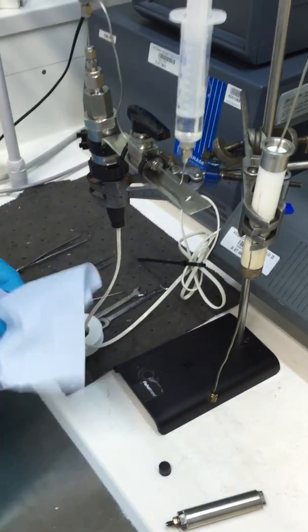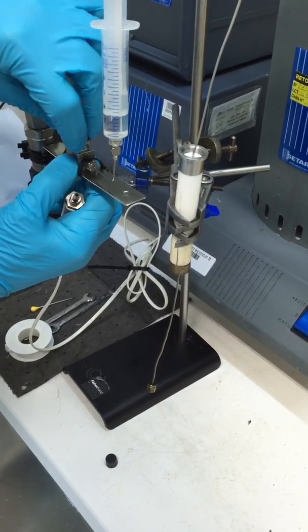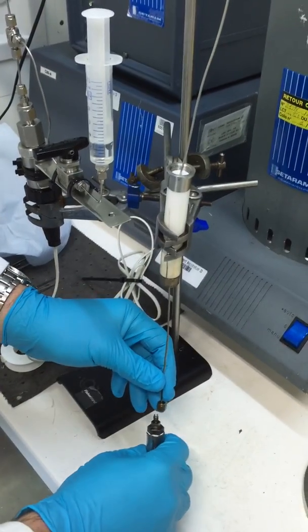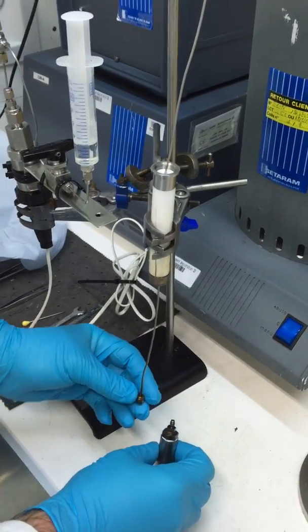This ensures that the line is clear by the oil running clear and free through the 16th inch fitting. It requires a bit of pressure to do that. If the line is blocked, we then cut the line and re-swage on a new nut.